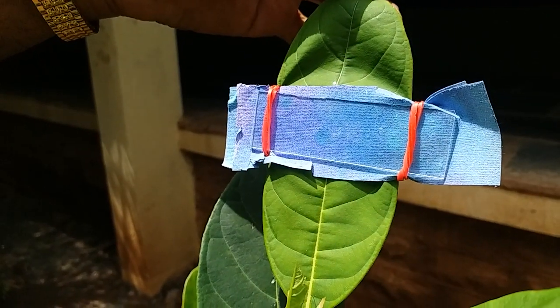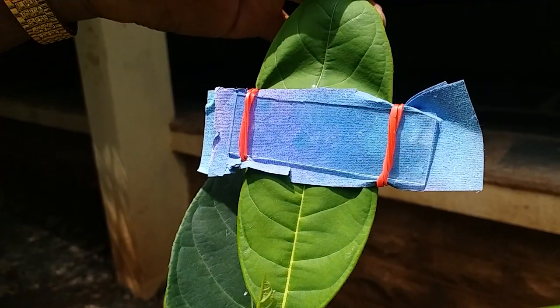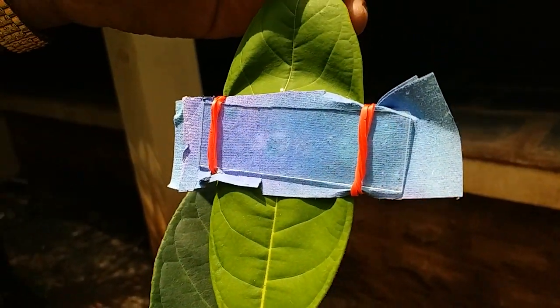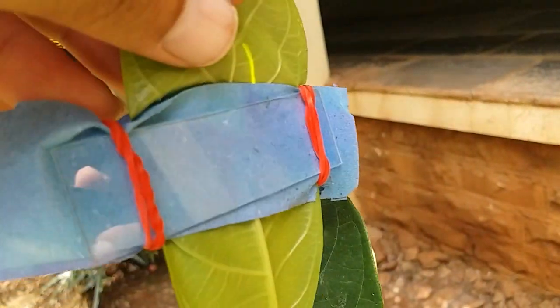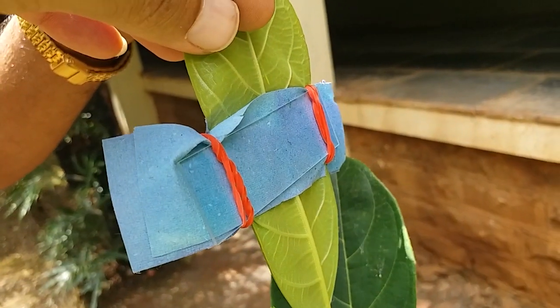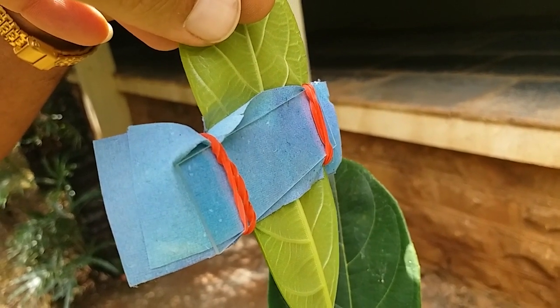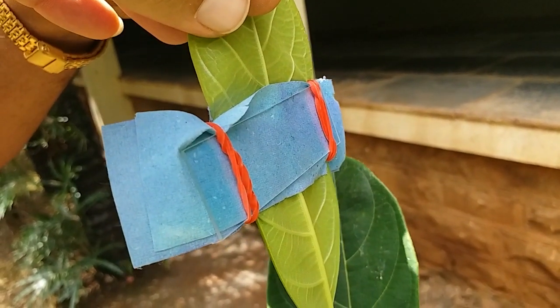In the same fashion, on the back side also, we have put the cobalt chloride paper and one slide. So we will keep this experimental setup for about 10 minutes and then observe the rate of transpiration.